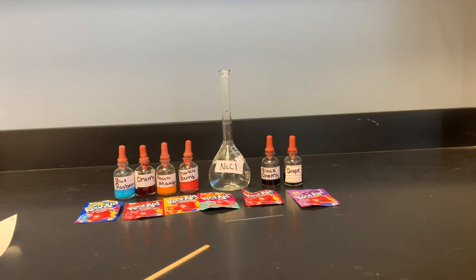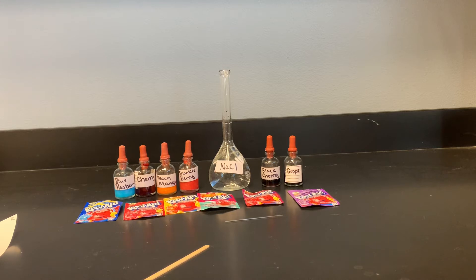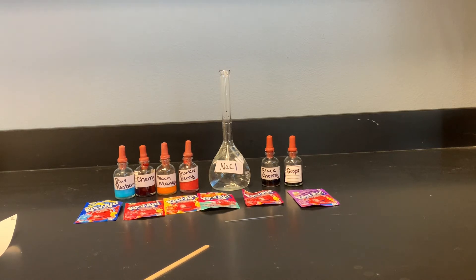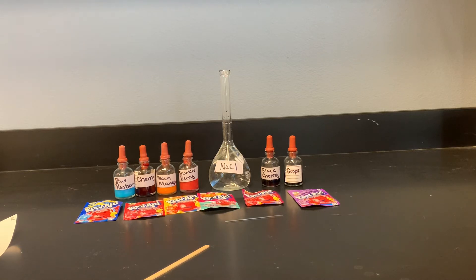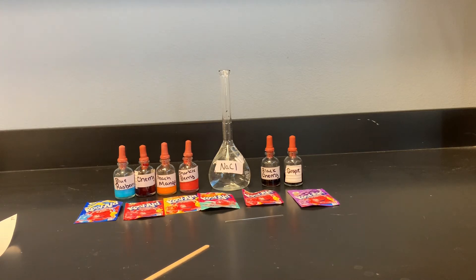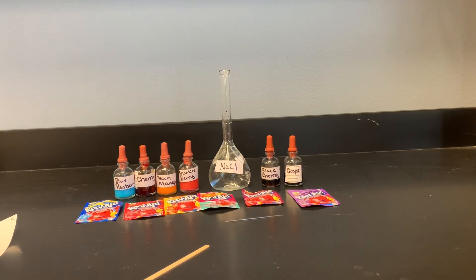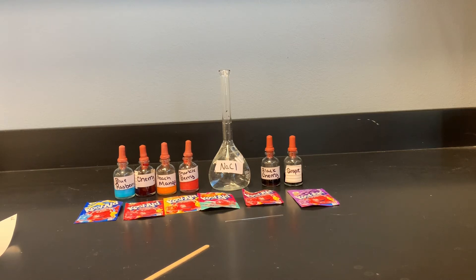Your challenge is: one, to separate them into their components; and two, if you do it right, every package that contains Red 40 should have the same RF value as that Red 40 in the grape. We should see the same for Blue 1 — whatever else has Blue 1 in it should also have that same RF value. For a reminder about RF values and how to calculate them, please refer to your lab — it has a diagram on how to calculate that. Make sure you pay attention to the parts in the lab so you can get your measurements correct.